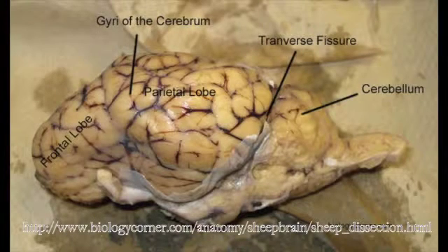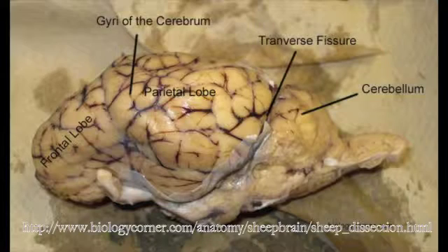The frontal lobe contains the primary motor area, which is responsible for controlling voluntary skeletal muscle movement. It largely dictates muscle that requires fine motor control, such as those in the face, mouth, and hands. This is our first area of interest because we wanted to learn how humans socialize and choose sexual partners. The frontal lobe is associated with social and sexual behaviors, as well as attention.